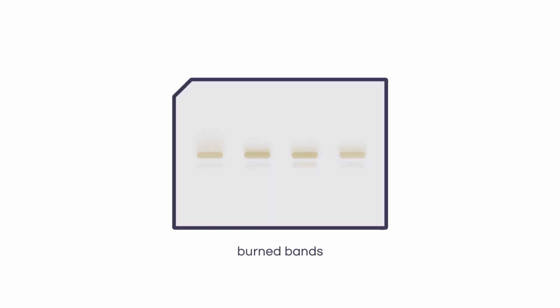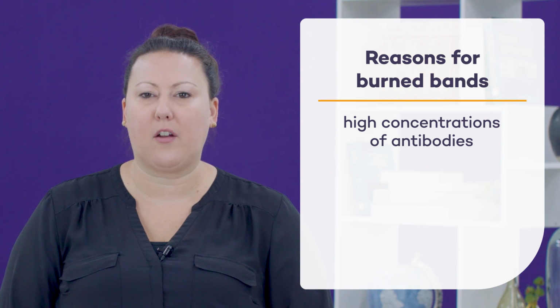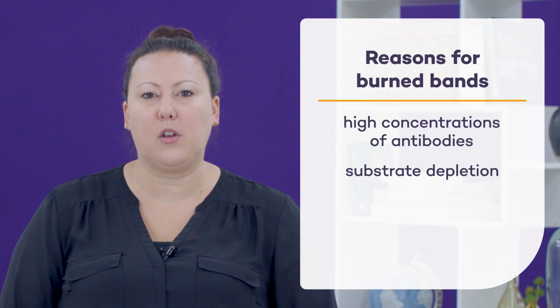Sometimes you may see the presence of brown or yellow bands on the membrane. These are often termed burned bands. Too high a concentration of antibody can not only cause high background, but can also use up all of the substrate added to the membrane before it can be detected. This can result in no or weak signal. Ensure to optimize both primary and secondary antibody concentrations.